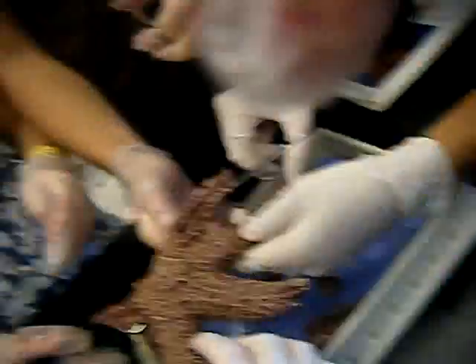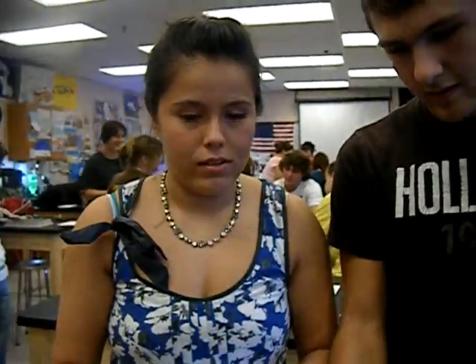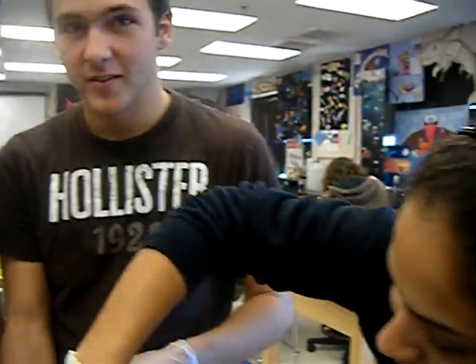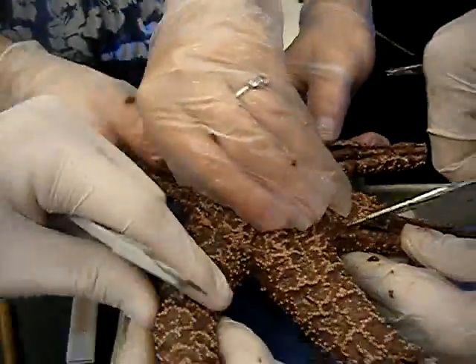God, I wish you had this smell. I can rip this part off and get the stomach. But we still have these two legs — it's okay, once we pull them off the whole thing will come off. Are you recording? Yes. Hi mom. I'm doing it. Mom watched starfish dissection at Stockton or something.